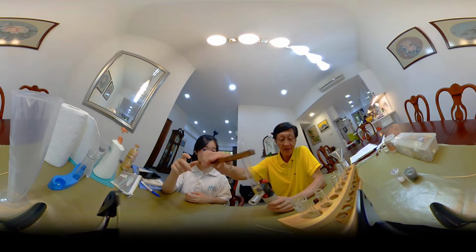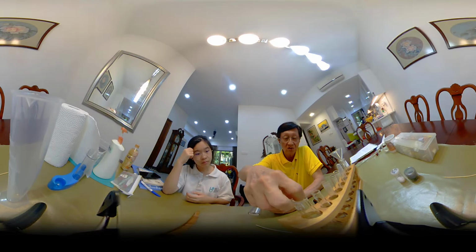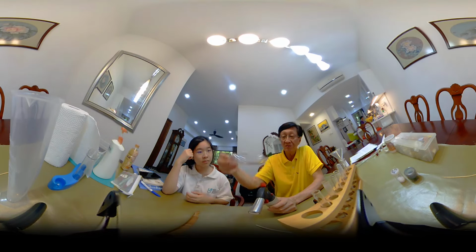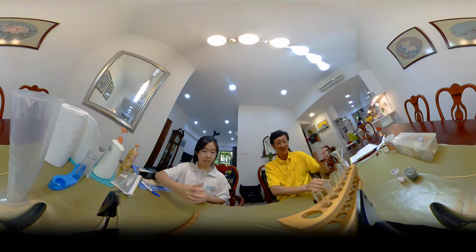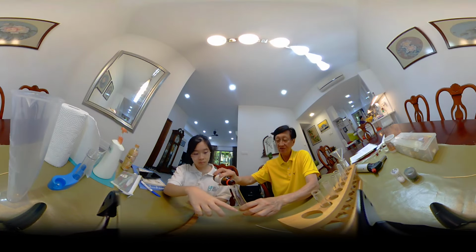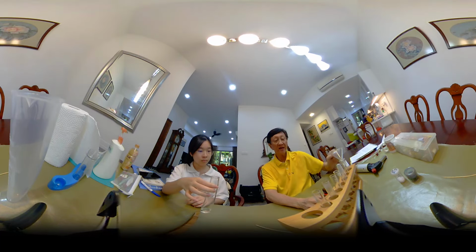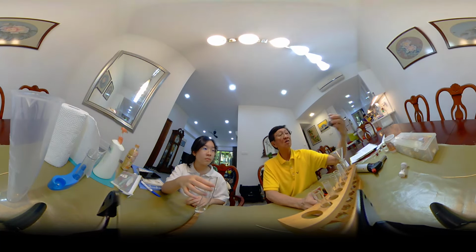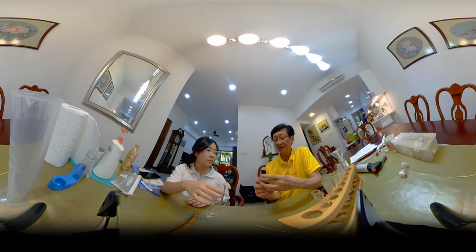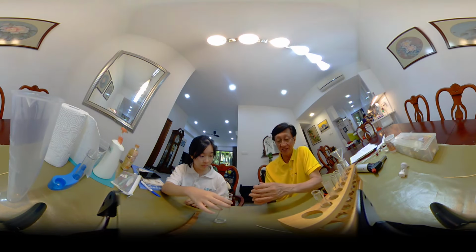But having said that, if I were to take a boiling tube, okay, and this time I put in hydrogen peroxide, okay, and I put a little bit of what we call a catalyst. Now this catalyst is what formula? Manganese dioxide.